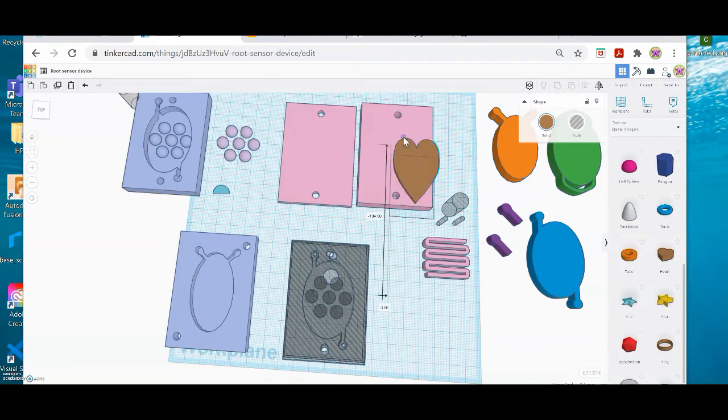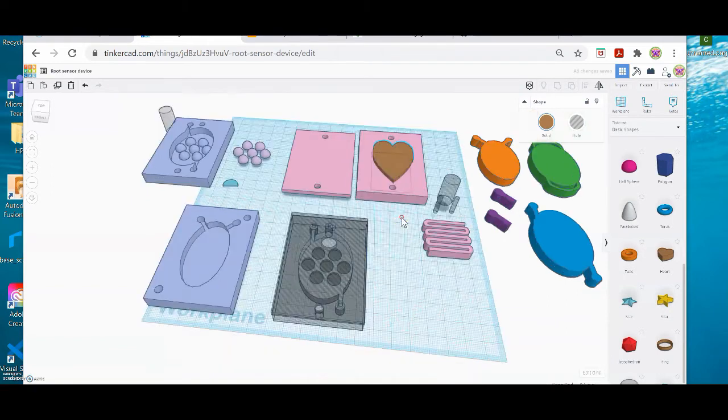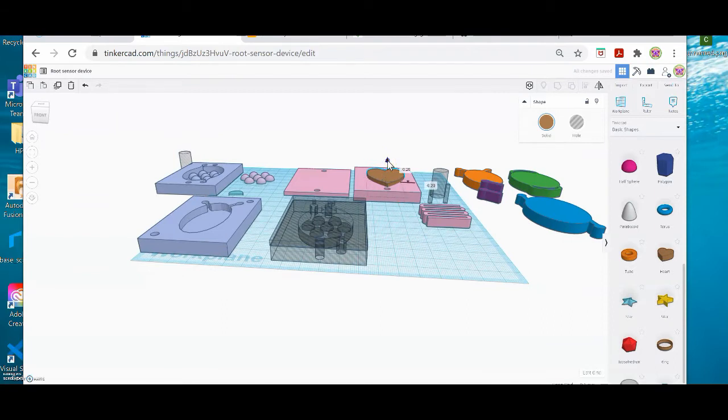So now I'm going to grab my heart, and I'm going to move it over here, and I am going to push it into my form a little bit.